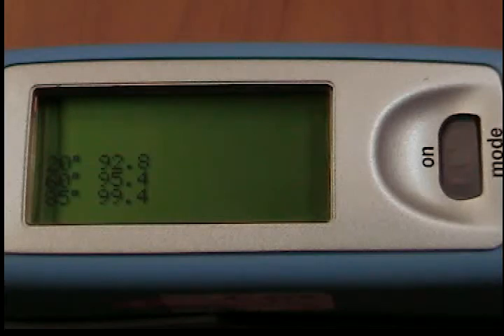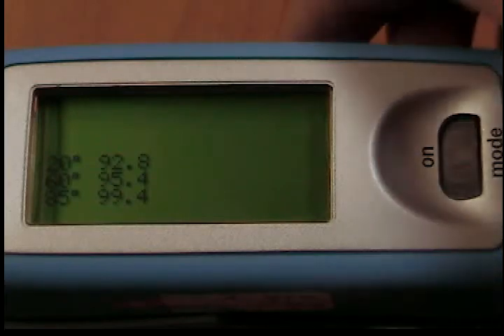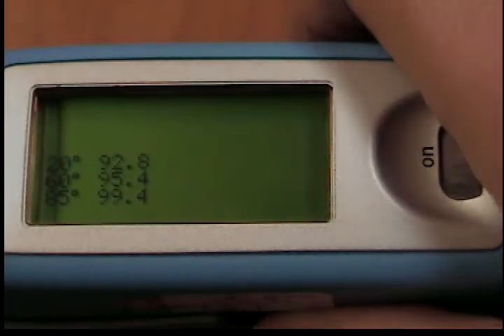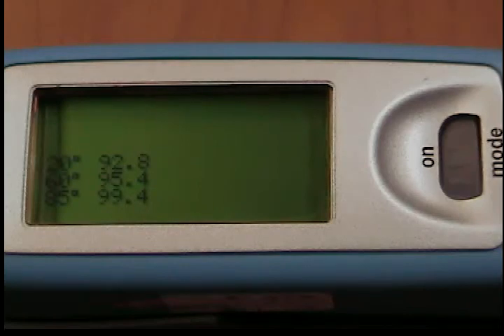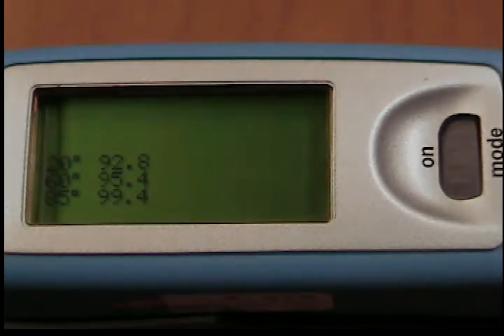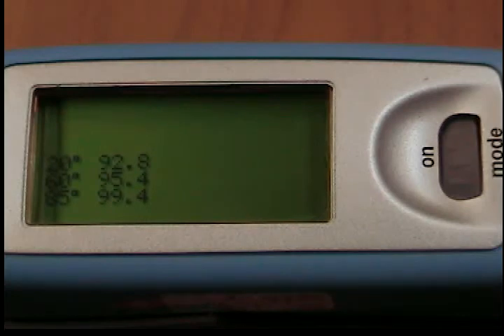Pressing operate initiates measurements. All control functions are controlled by the mode scroll wheel. Pressing the wheel causes a menu to appear in the display.